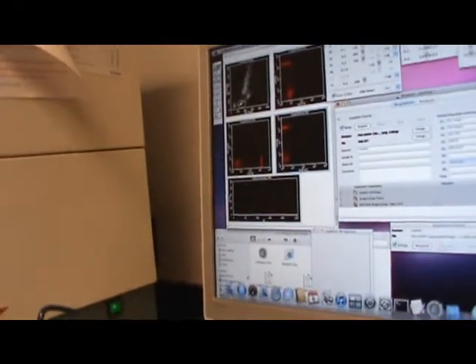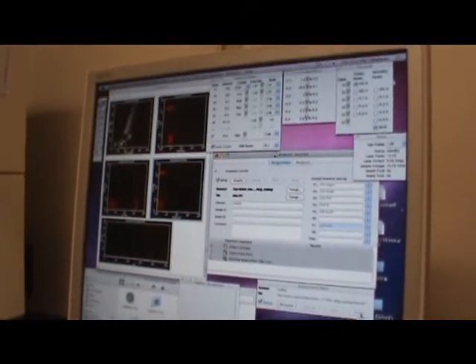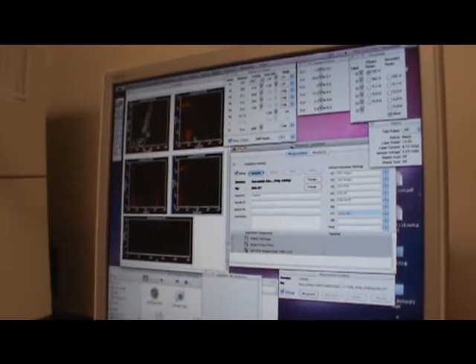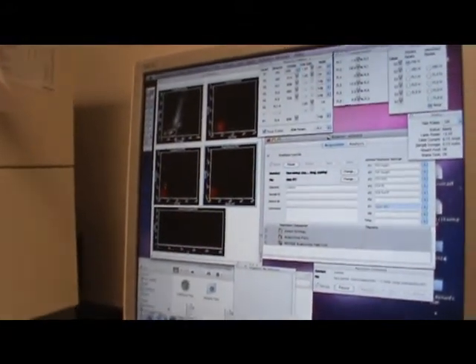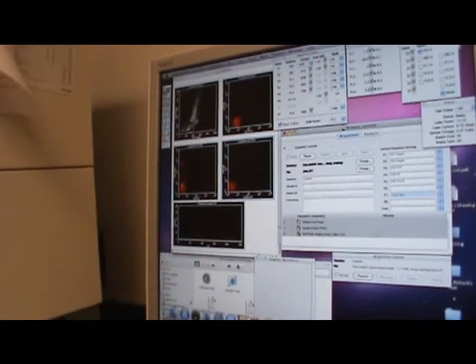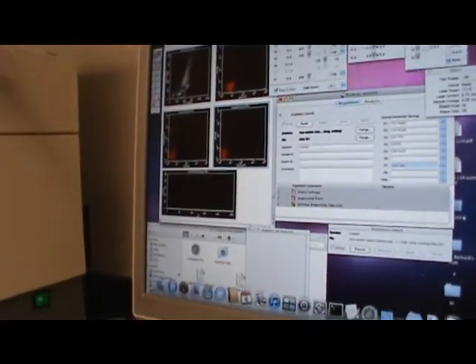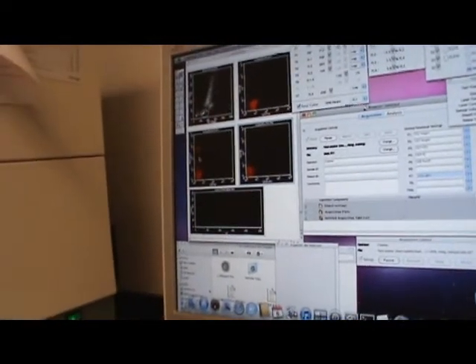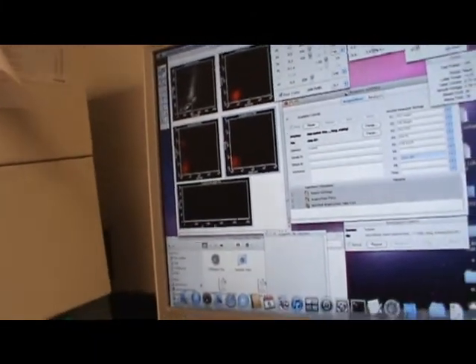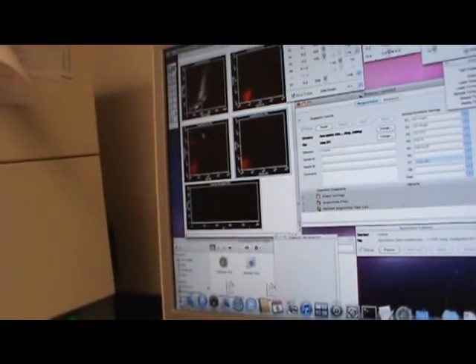Now let's look at the third color. Is it making sense? Yeah. Then you take your PerCP and you go acquire. This is perfect. It looks very good, PerCP. But this is between 4 and 3. It can be a problem between 2 and 3, but usually we generally don't change that much, but depending on the experiment, anything can. So I'm just gonna try this, 3 and 4, okay?